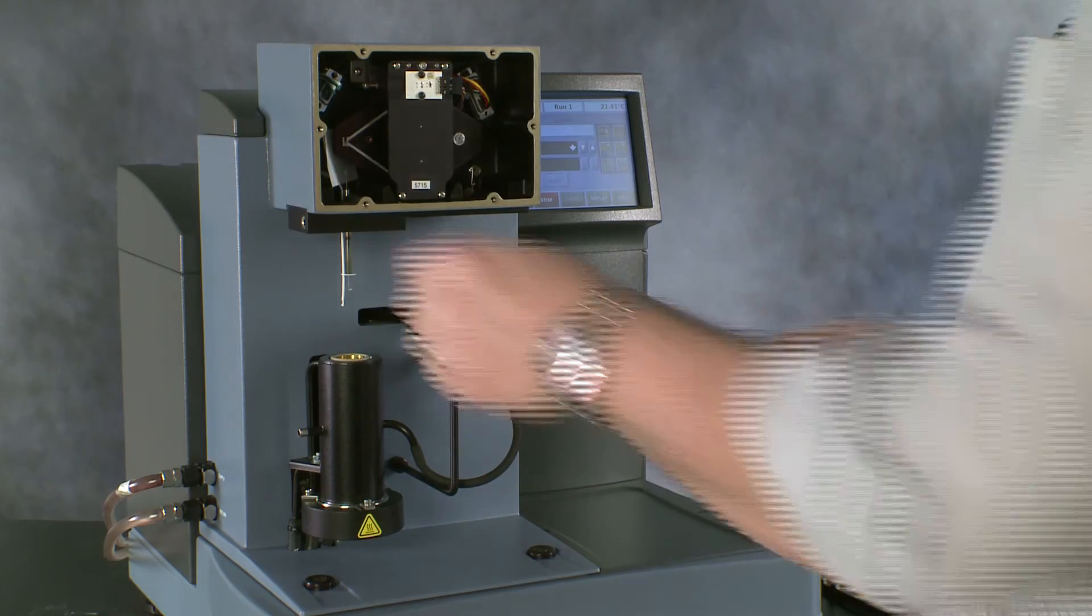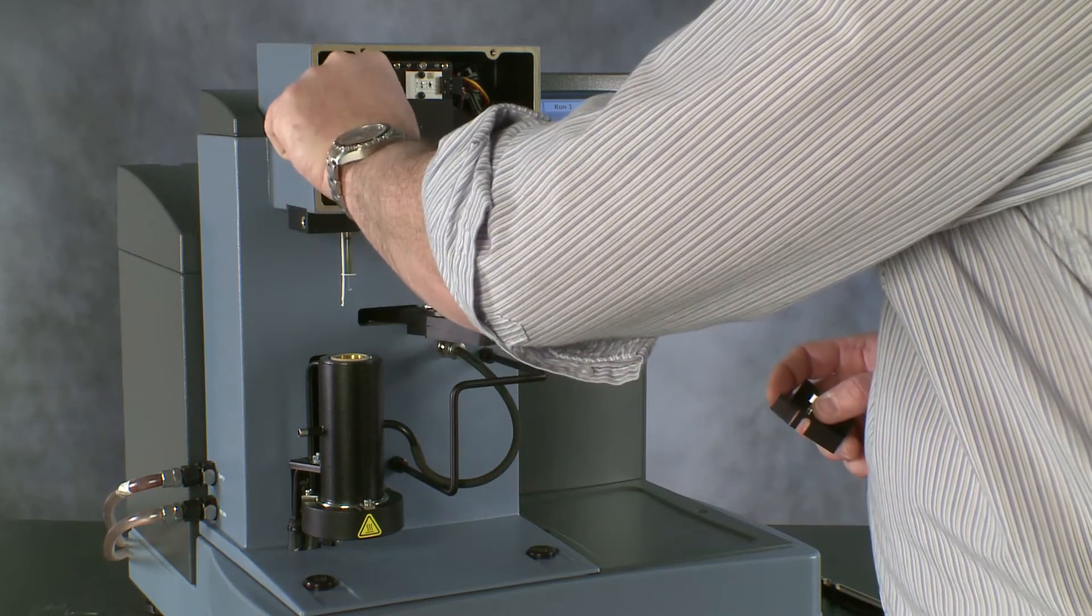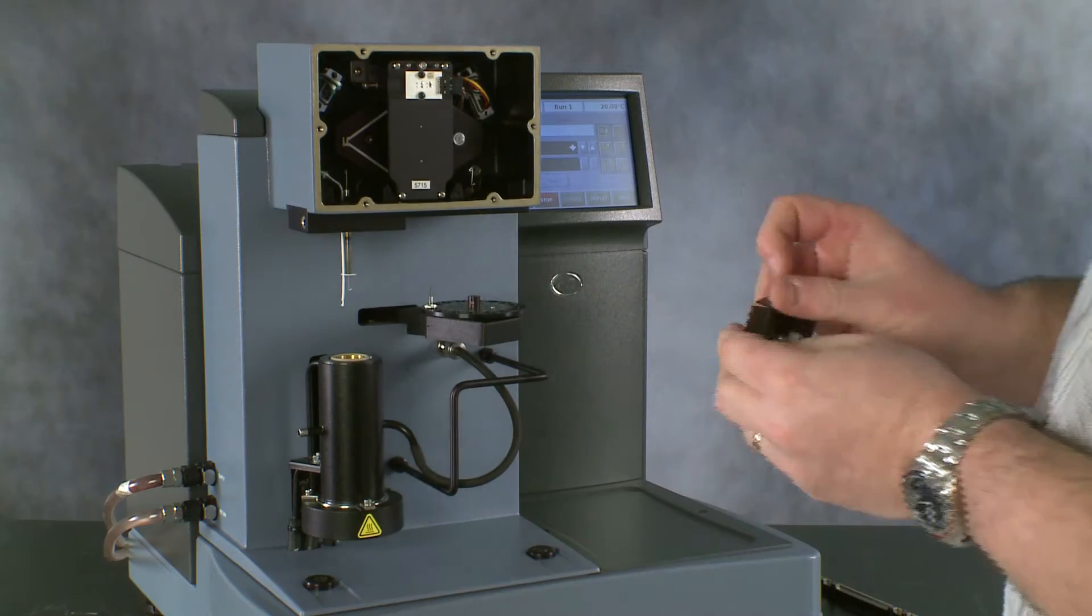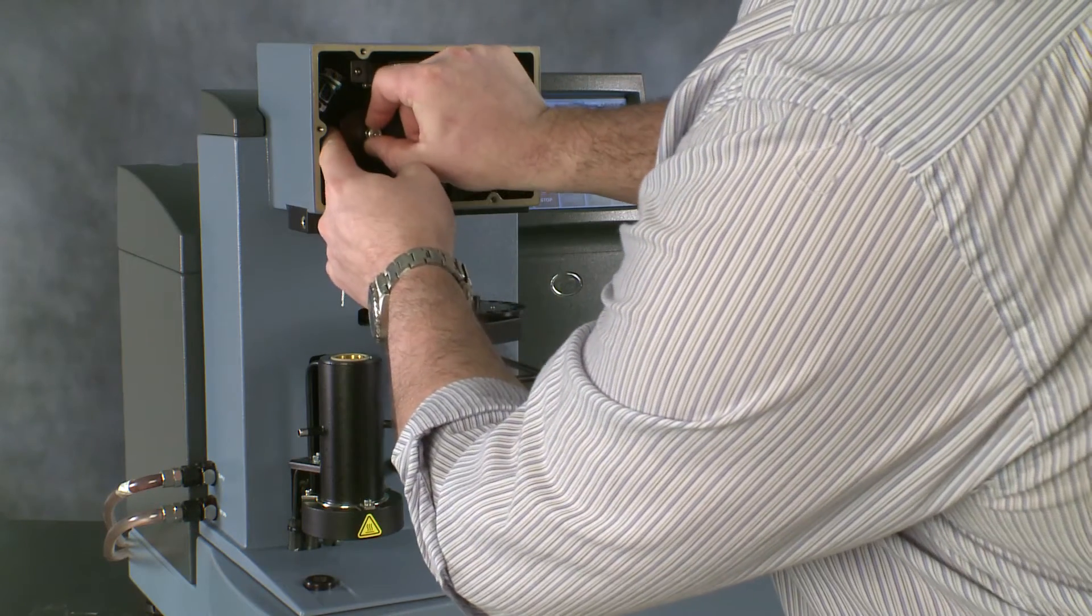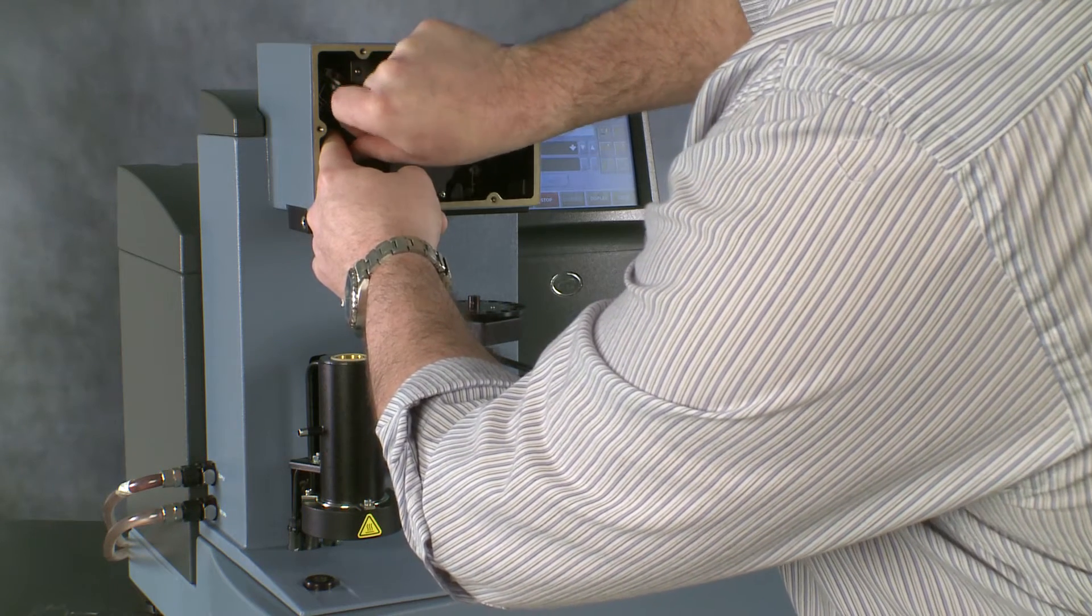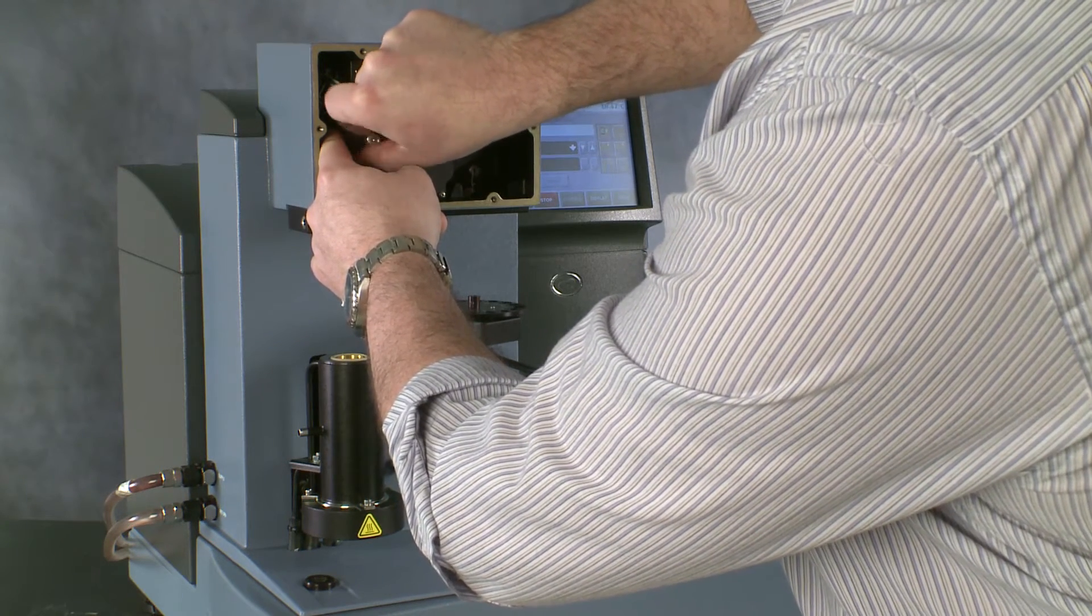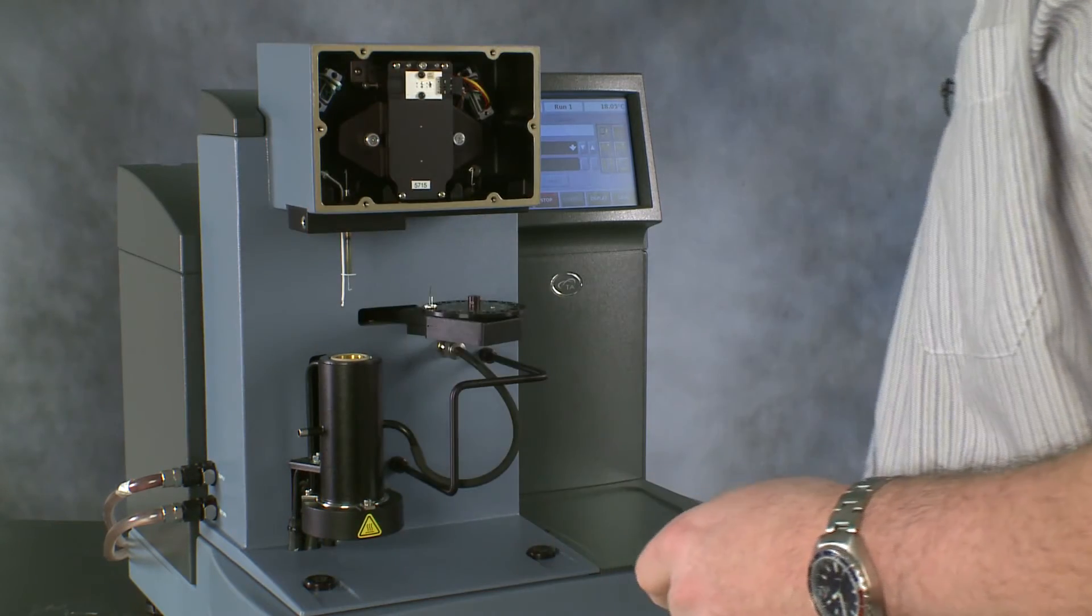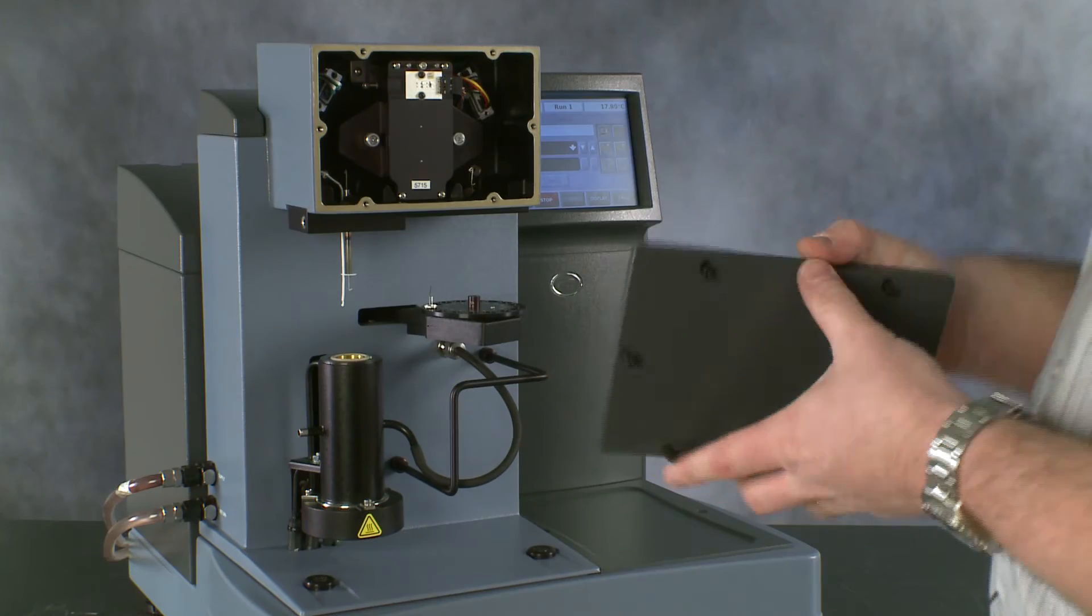So, our new hang down wire is installed. We can remove the paper. We can put the balance cover back on. And we can put the balance housing cover back on.